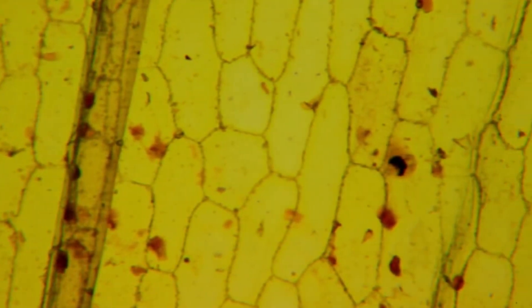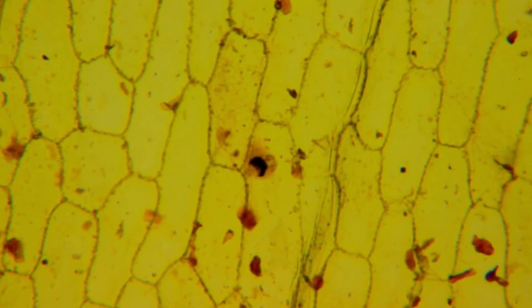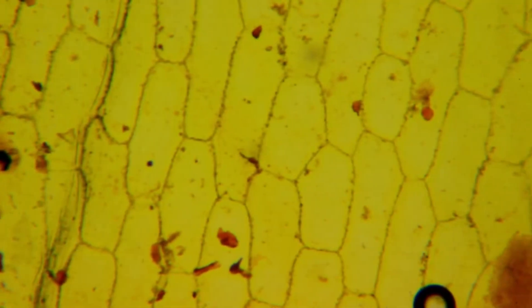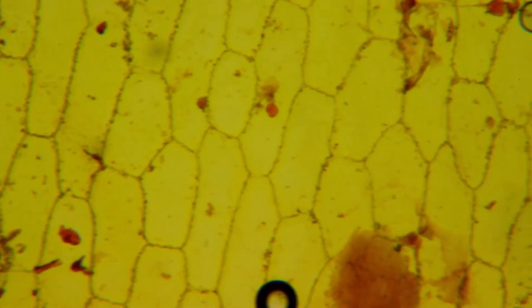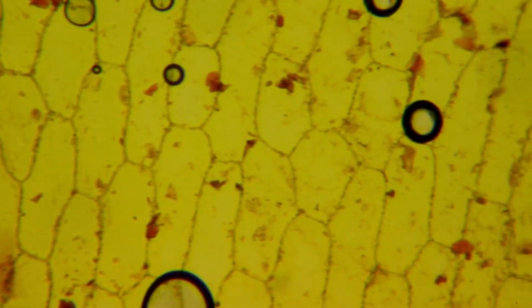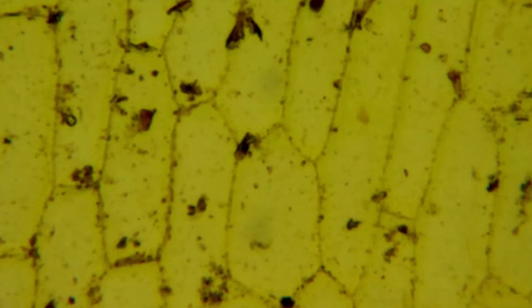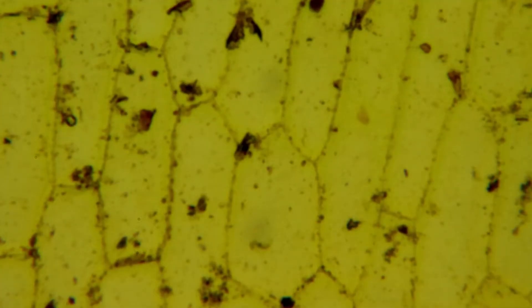When we observe these cells under the low power, we see hexagonal cells and sheets of them. There is a sheet of these cells visible under the low power.